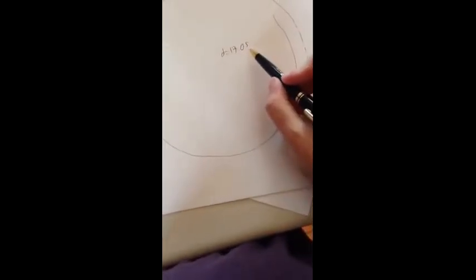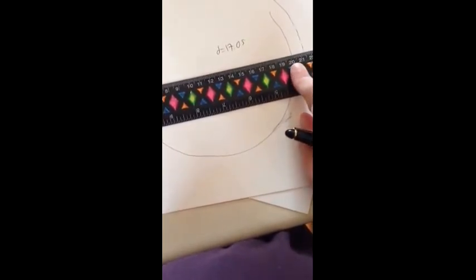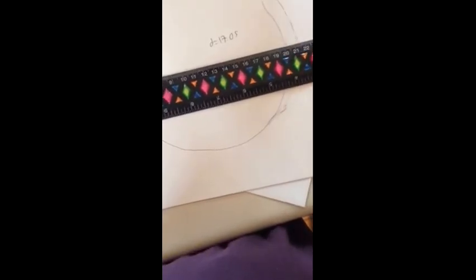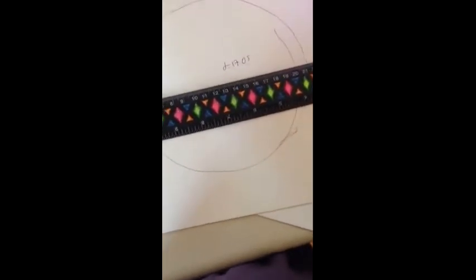There's a lot of room for human error there, so being specific to the 100th place is really just practice for you in using a ruler, because the ruler you can estimate to that specific precision level. However, this measurement as a whole, being the sample that we're working with, is going to have some human error associated with it regardless. Okay, just a side note.